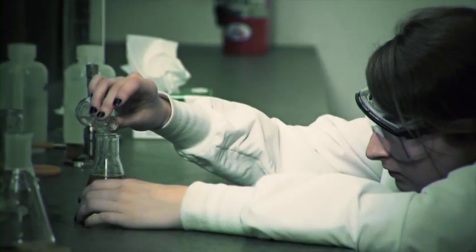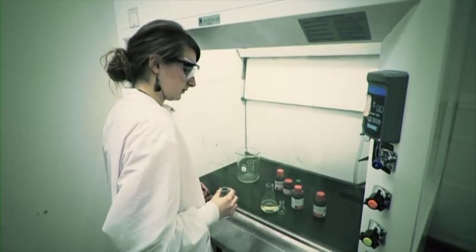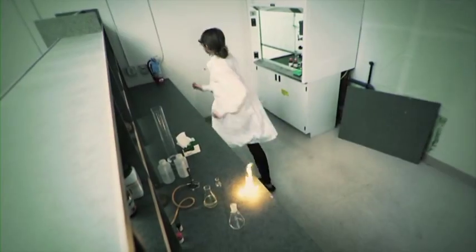On March 9th, 2010, a graduate student was checking on their fractionation process equipment involving liquid ether. At 1:30 in the morning, the ether vapors ignited, starting a fire. The student grabbed a fire extinguisher, but the fire spread.